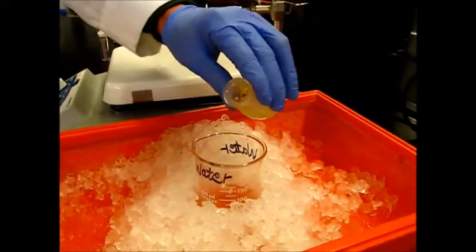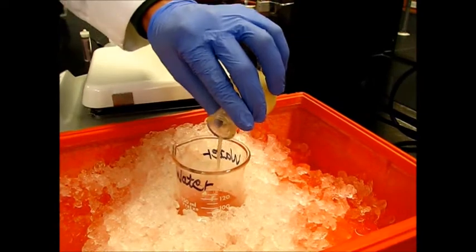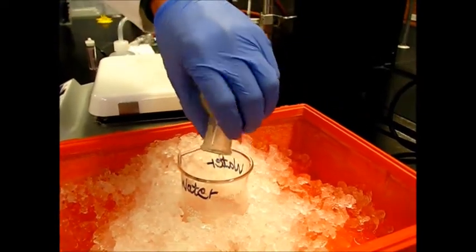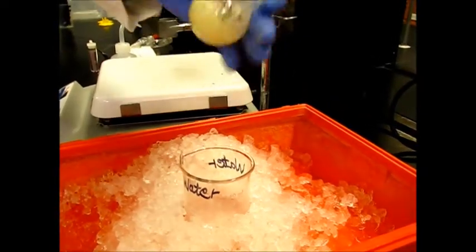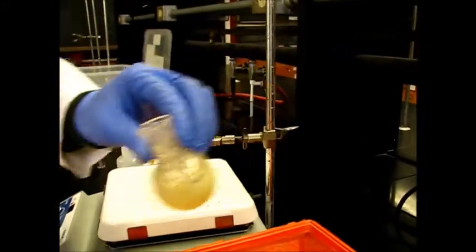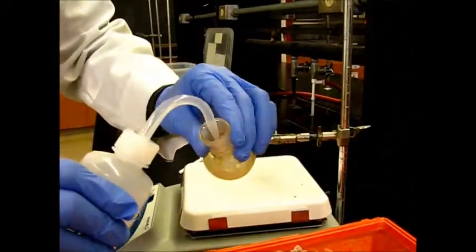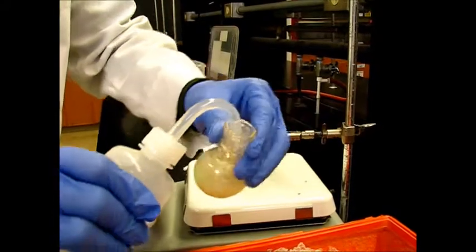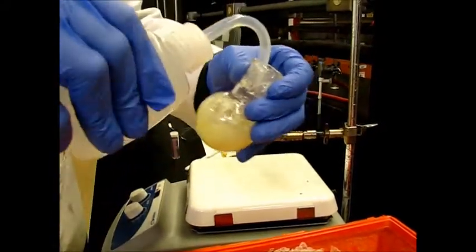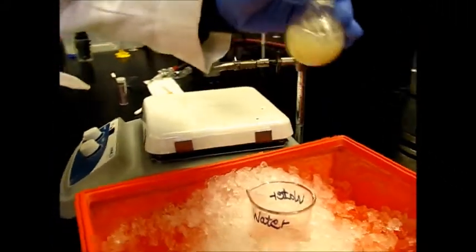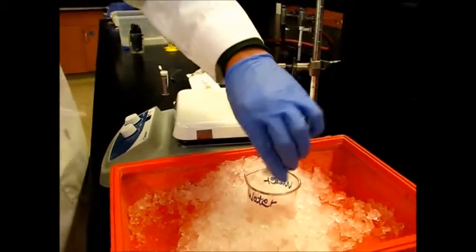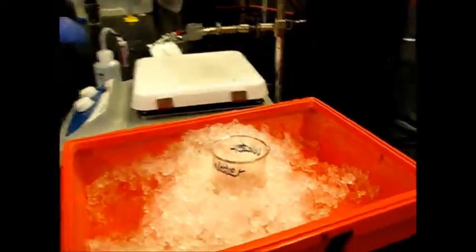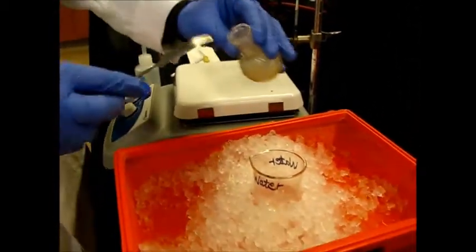We're going to dump the whole reaction mixture into this water. We'll take out the wash bottle to try and get some of this stuff to come into the solution a little bit easier. We can also use our spatula to kind of scrape it.